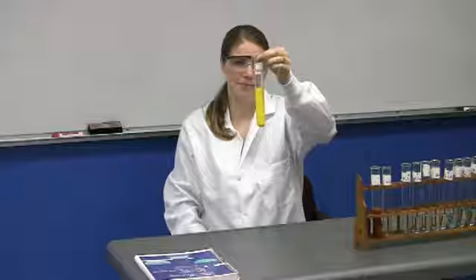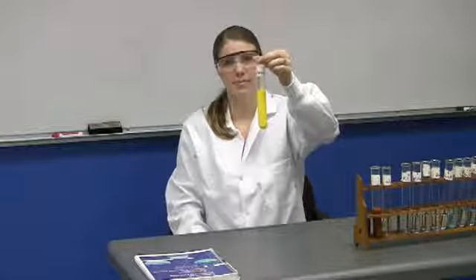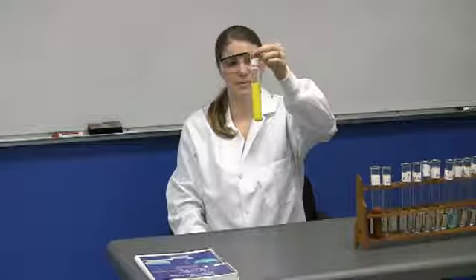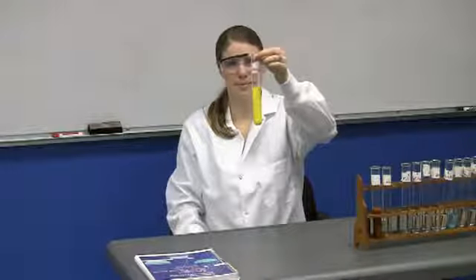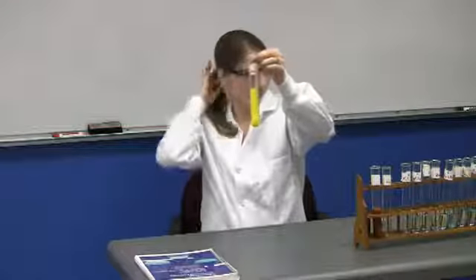Notice that in both of these reactions so far, the test tubes, before they were mixed, contained solutions that look just like water. After mixing the solutions, again you see a precipitate. So once again they complete the equation, and they use the solubility rules to figure out which of the possible 2 products is responsible for that precipitate.